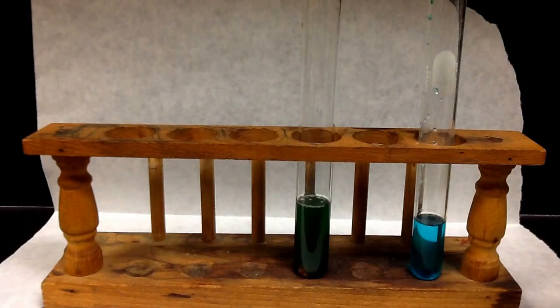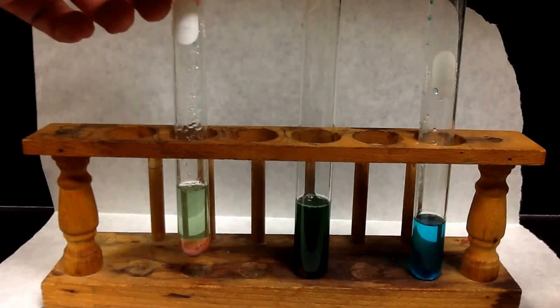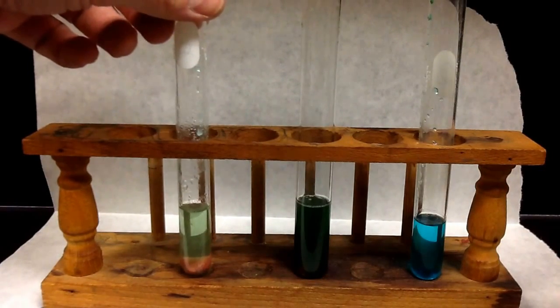And so this reaction would actually go on for quite a while. So what I did is that I started another reaction ahead of time, and I'll show you what it looks like towards the end here. So this is what it looks like, and you can see that the color is significantly different.